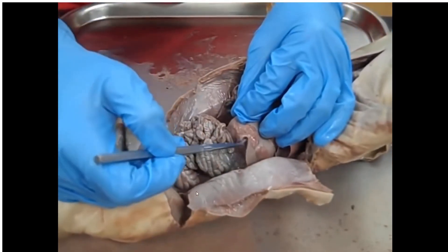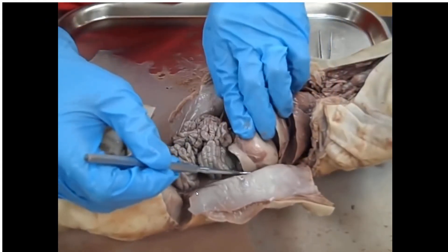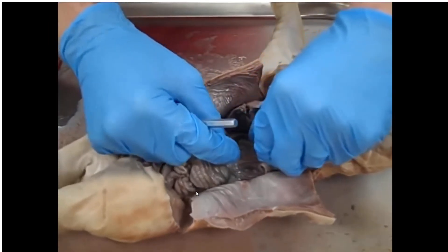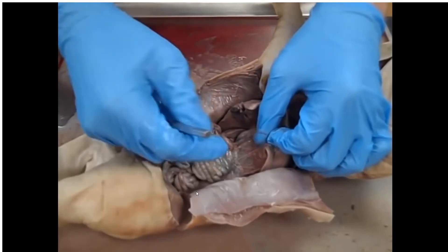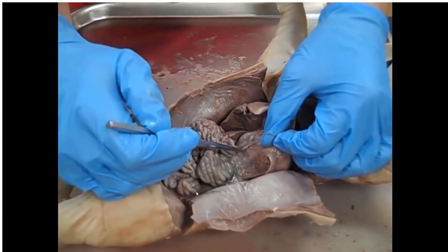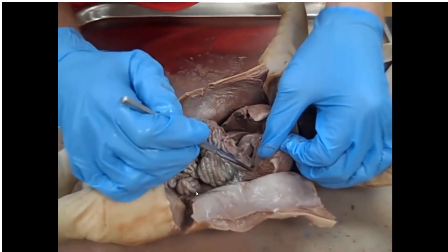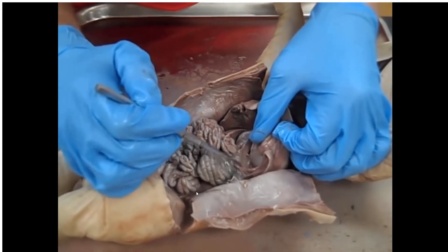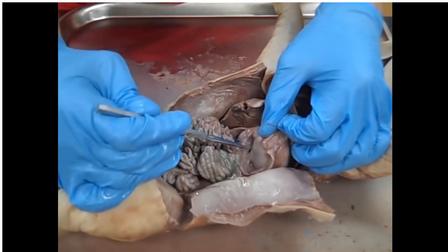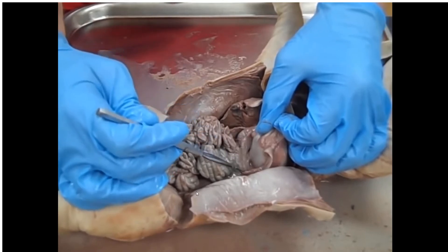Over here we have the ribbon-like spleen, over on the left side of the body. Then he's looking for the pancreas — might have to work for it a little bit. There's still some connective tissue in the way, but the pancreas would be located right here, just behind this connective tissue. If we can gently tear through it — the pancreas itself is going to be extremely delicate. Right in here there's some glandular tissue, and that would be the pancreas. You typically find the pancreas very close to the curvature of the stomach.